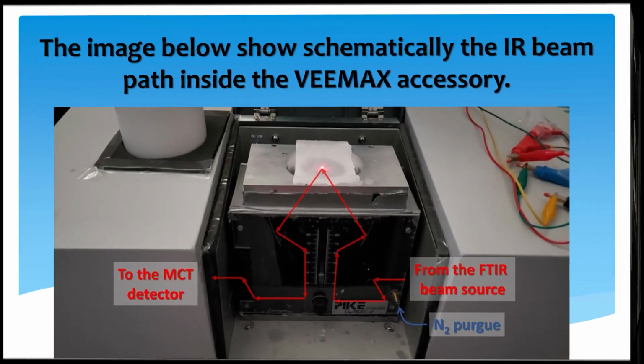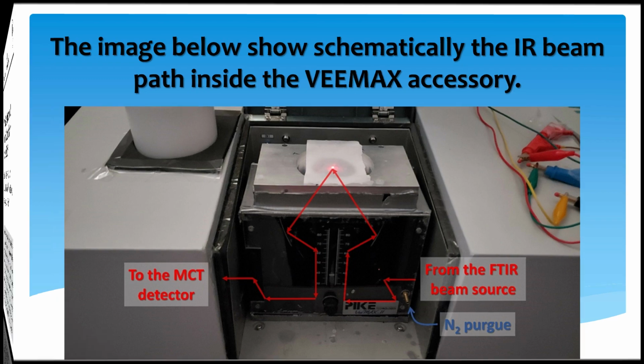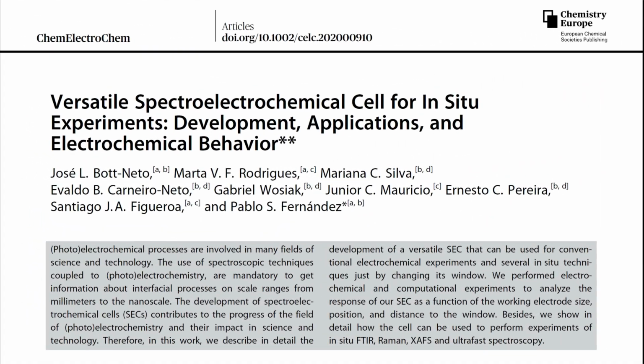you will see soon. We have made a figure here for you to have a better idea of the IR beam path inside the accessory. At the top of the accessory, we have inserted a homemade lid to adapt one or more of our spectroelectrochemical cells. Okay, now we need a cell.